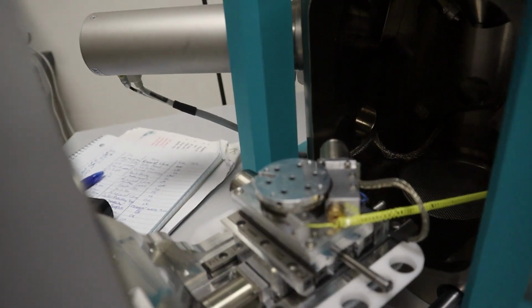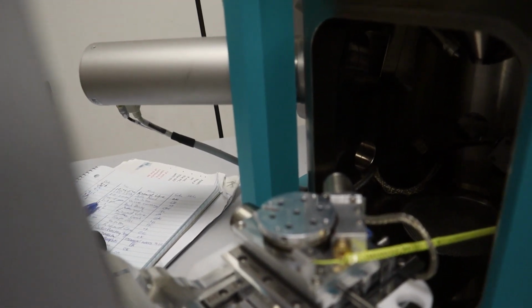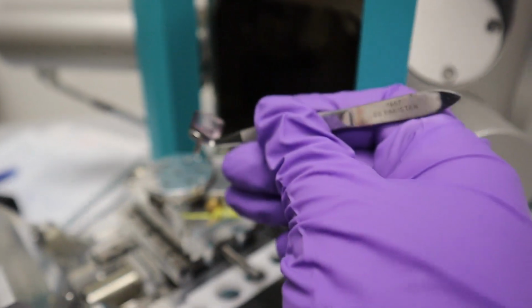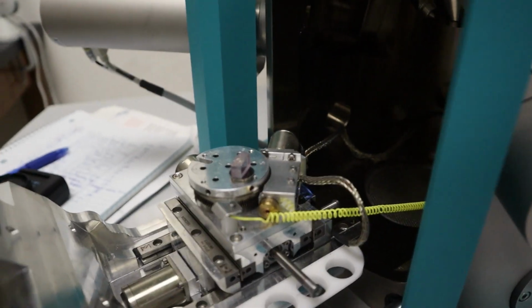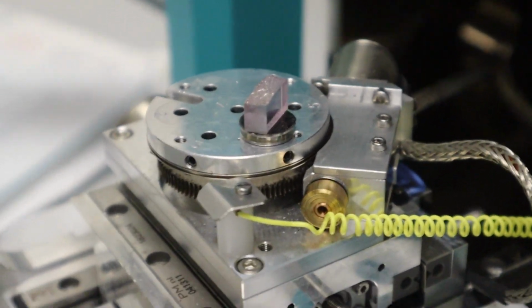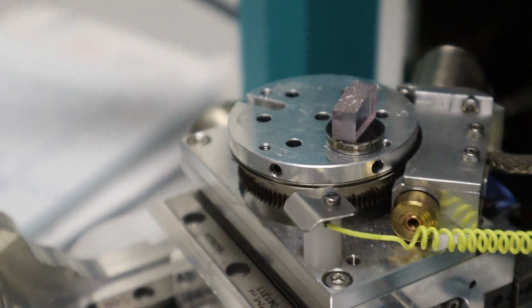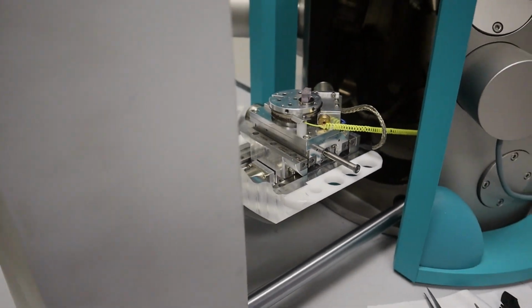And I'm going to load one of our samples inside. When loading samples into the chamber, you want to make sure to use a pair of tweezers or wear gloves. You don't want to touch any of the chamber surfaces with bare hands. So the SEM stub just fits in there nice and neat. If you want to, we have a tightening screw, a set screw for each position. So if you want to tighten down your sample, you can.